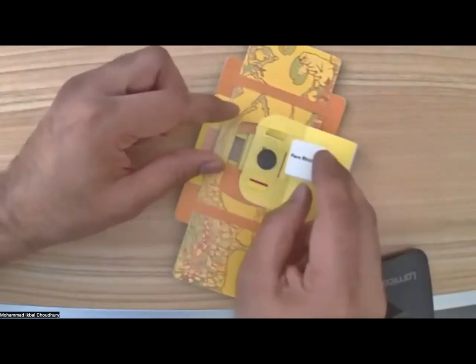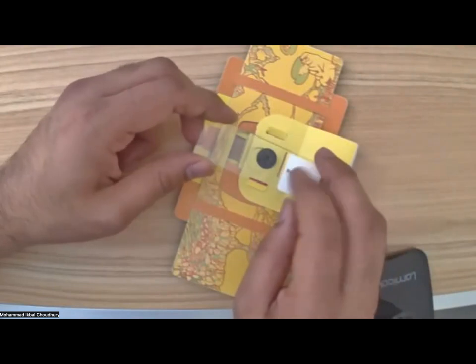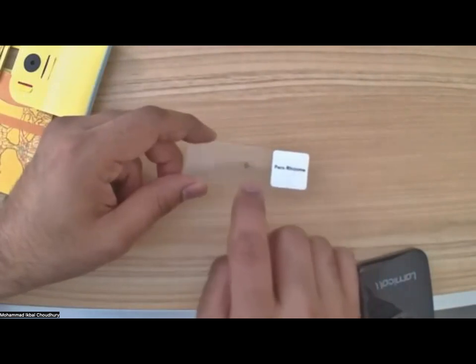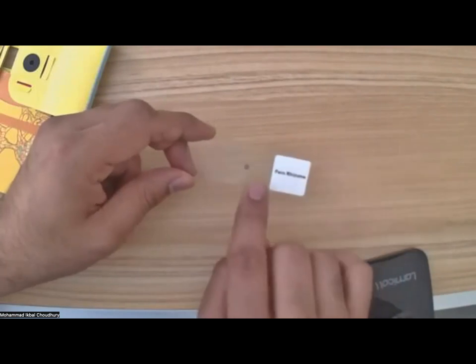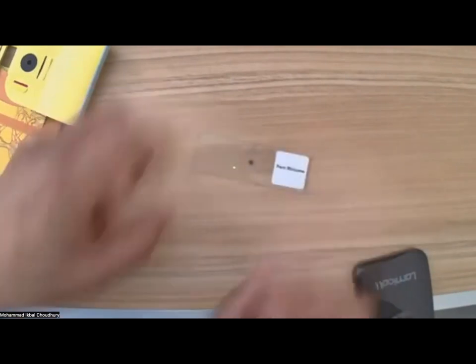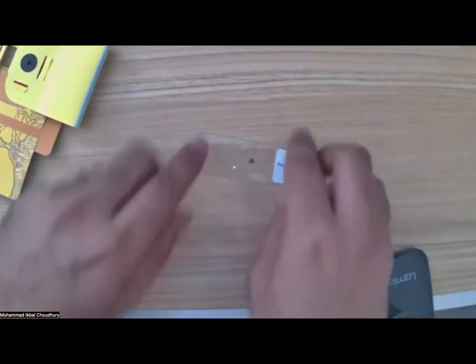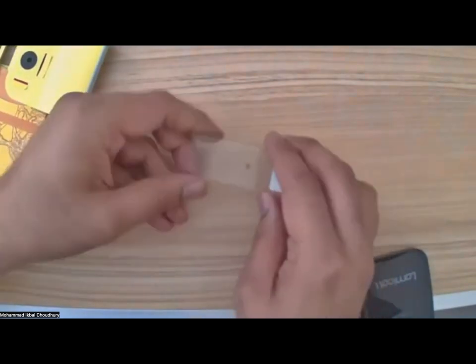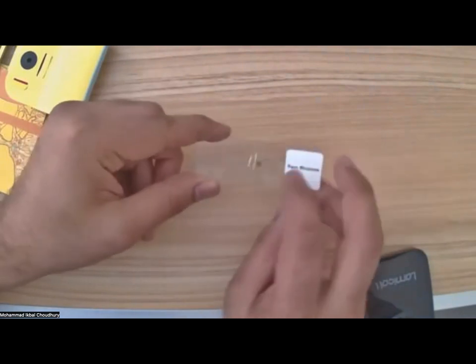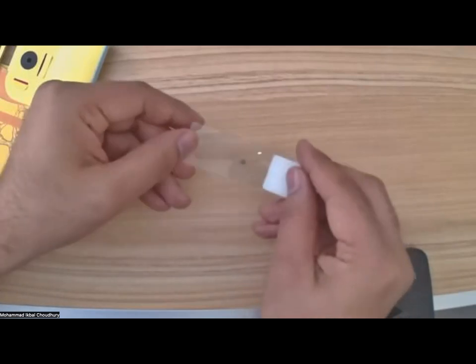Before we mount the slide on the microscope, it's important to visualize where the sample is. We can see the sample because it's transparent, right? But the sample is on one side of the glass. If you touch the sample, you will see the cover slip here. That's a tiny piece of glass. If you flip the sample, you will not be able to touch it, right? So you can see the cover slip. It is important to place the cover slip side of the sample towards the lens, okay?